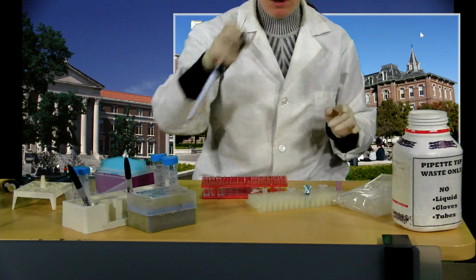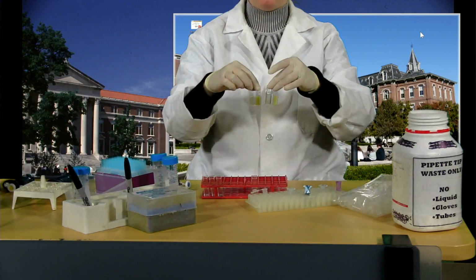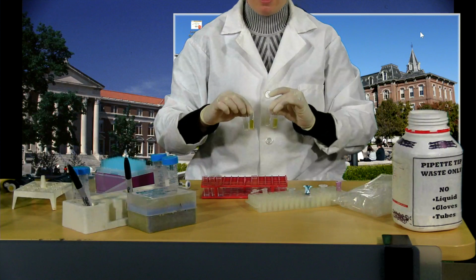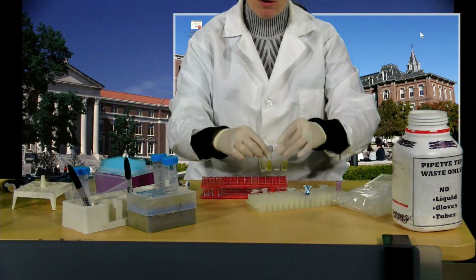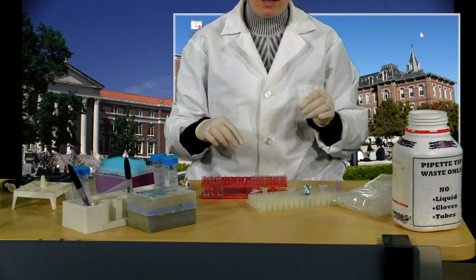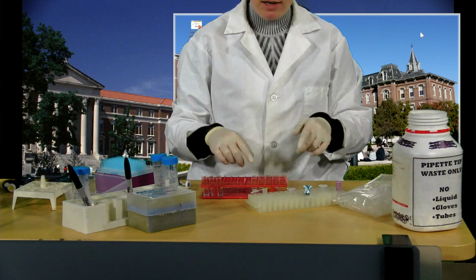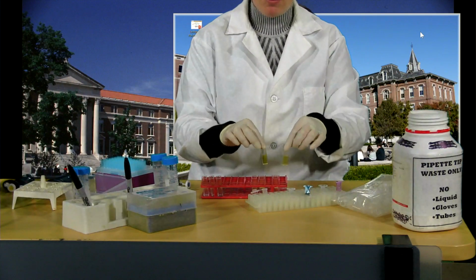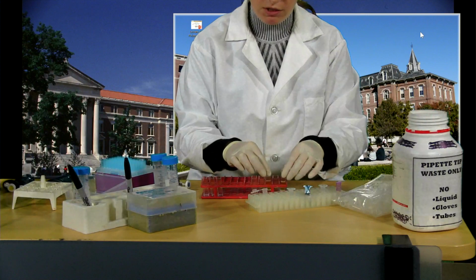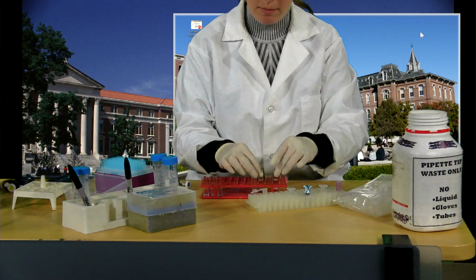Okay, so the first thing we notice here, guys, is the difference in color. As soon as I pipetted these into the cuvettes, I can see that there are variations in different colors of yellow, and that's what I would expect to see when the product is formed. The next thing I notice is that the undiluted samples are a very, very intense yellow, and they are going to be too yellow to read with any degree of accuracy on the spectrophotometer. So at this point, I'm pretty glad that I did set up my dilutions as well.